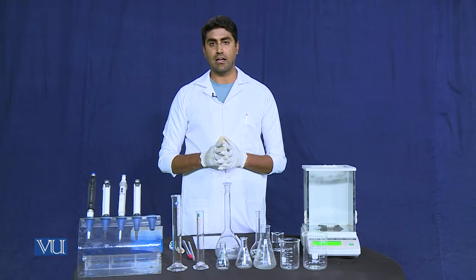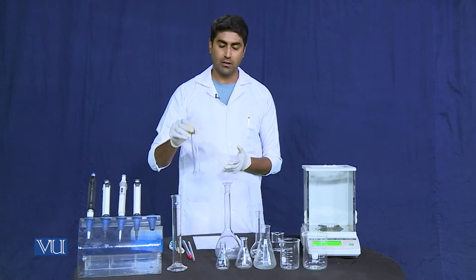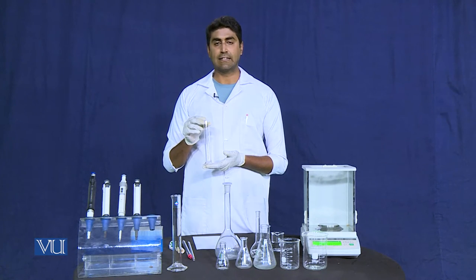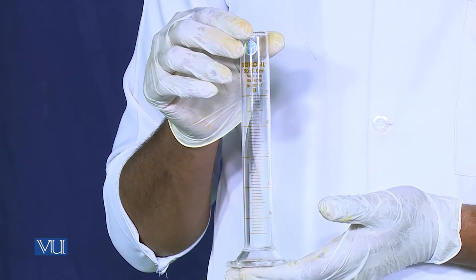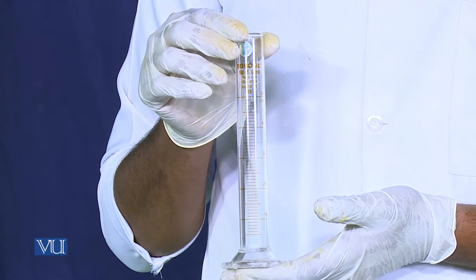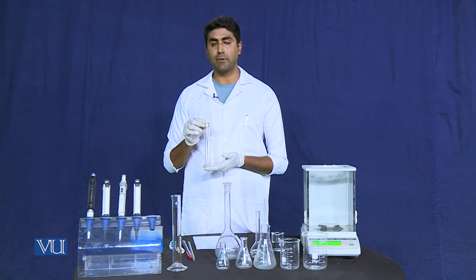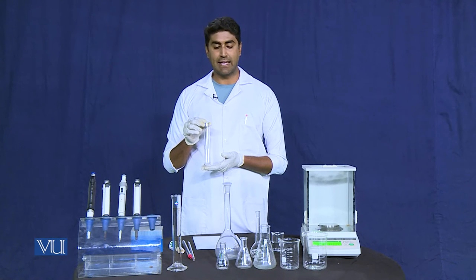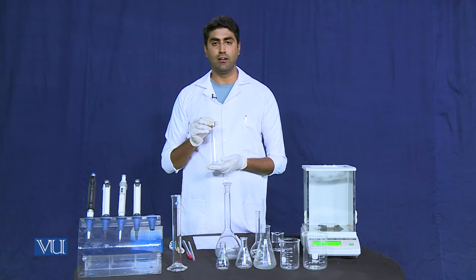The next glassware we have is the graduated cylinder. The graduated cylinder is used for measurement of liquids with up to 1% instrumental error. It is considered to be more precise for measurement of liquid volume than the beaker and conical flask.